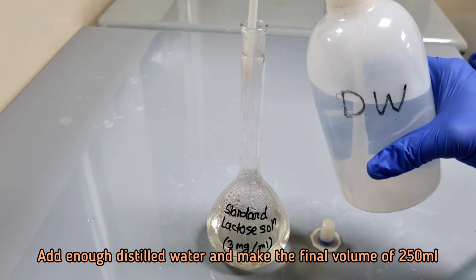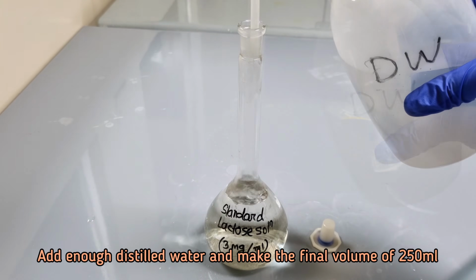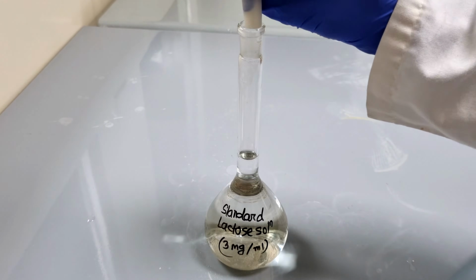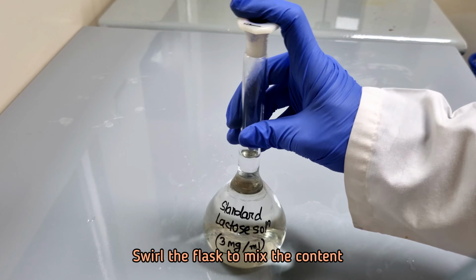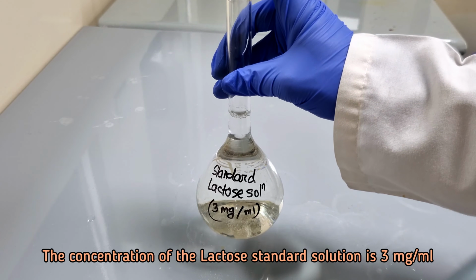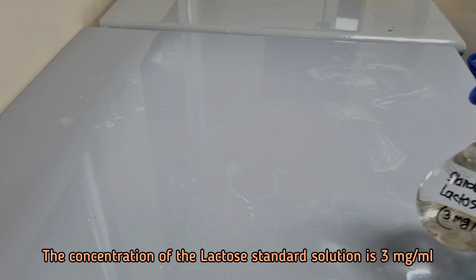Add enough distilled water and make the final volume of 250 ml. Preparation of lactose standard solution is done. The concentration of this standard solution is 3 mg per ml.